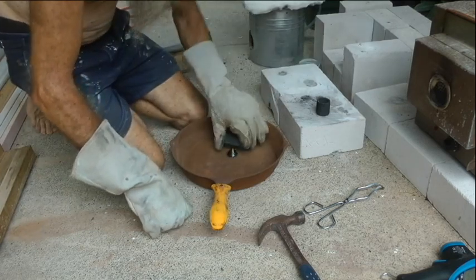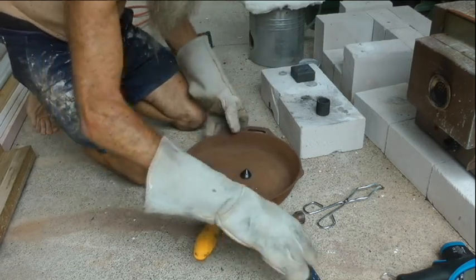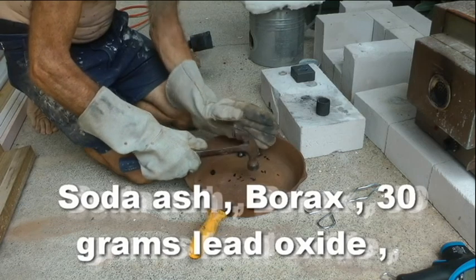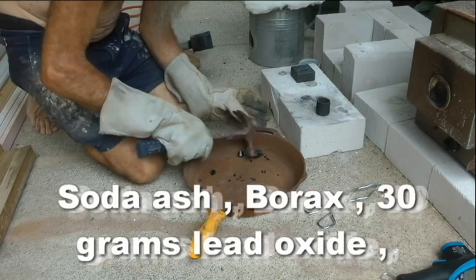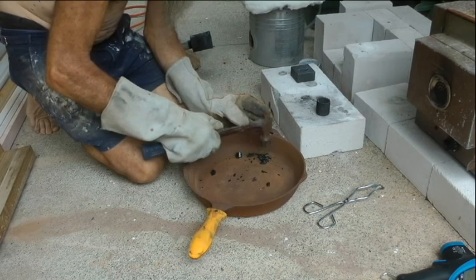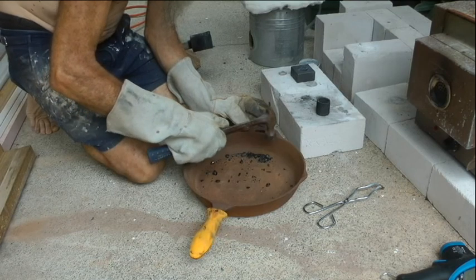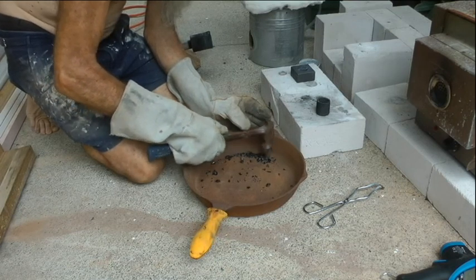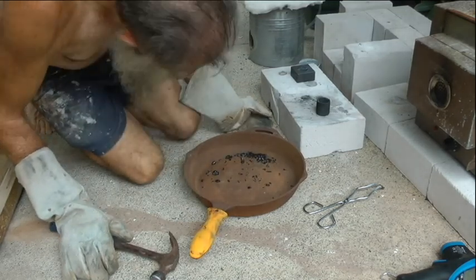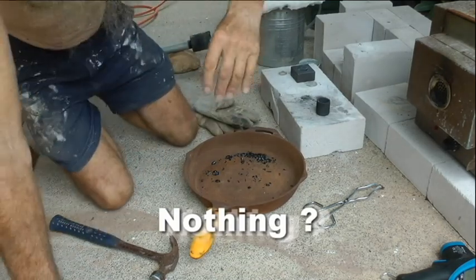It didn't all come out of the crucible. Just shit. Unbelievable.